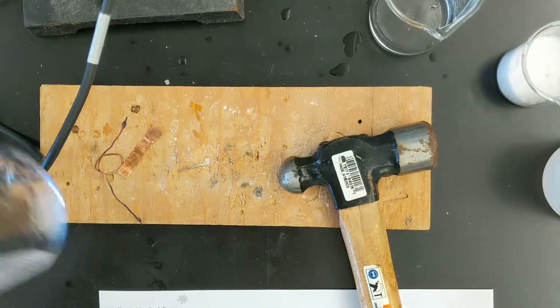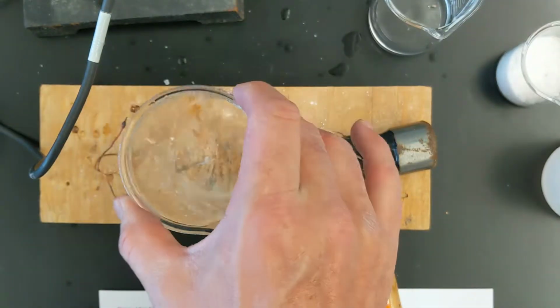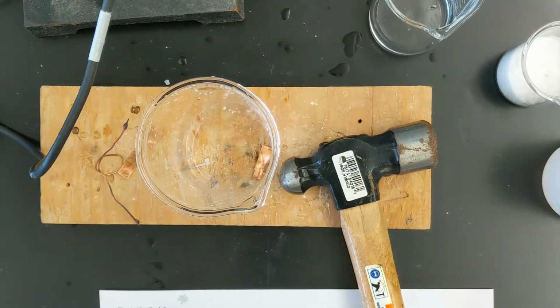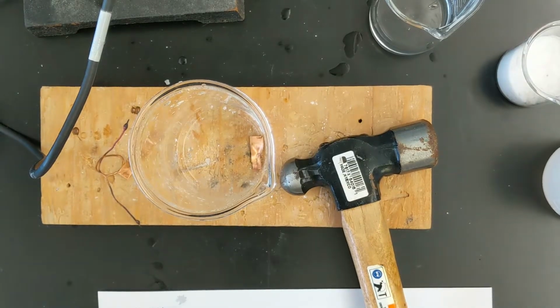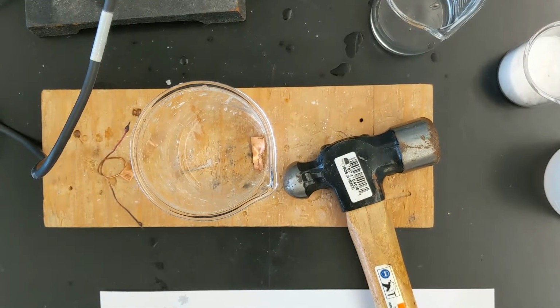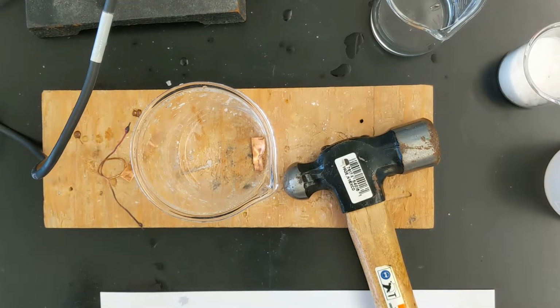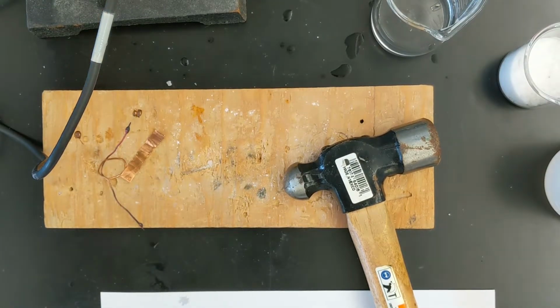Next one, solubility in water. So let me take my water here. I've put some water in there, and as you might guess, copper doesn't dissolve in water, so it is not soluble in water. Because it doesn't dissolve, the next column, conductivity in water, is not going to be applicable, meaning we're not even going to test it. The only time we test conductivity of a solution is if it forms a solution. If it doesn't dissolve, then it doesn't form a solution.